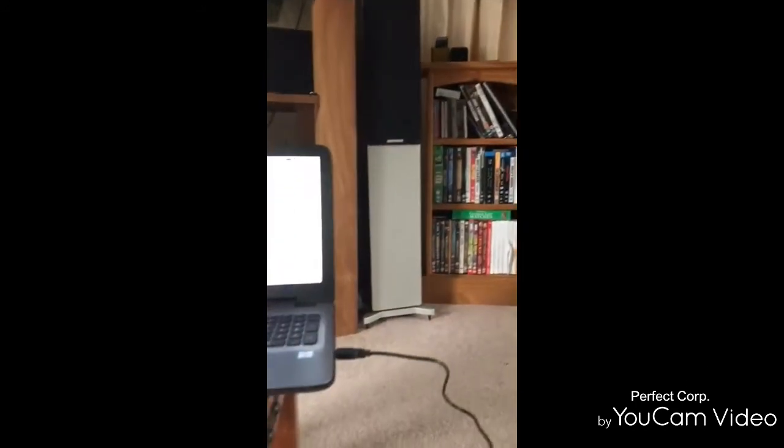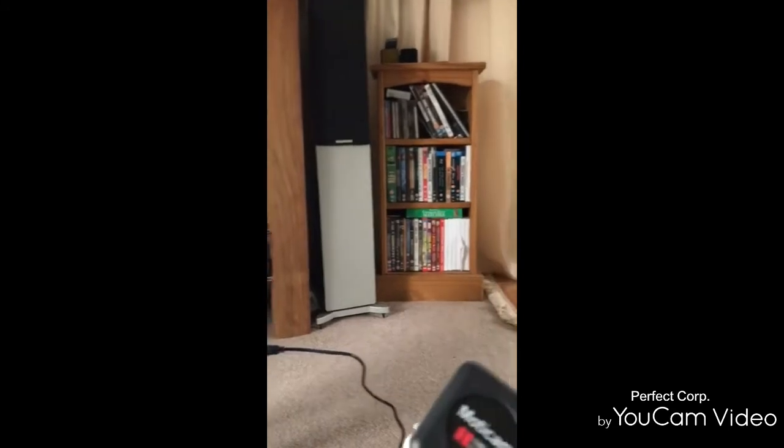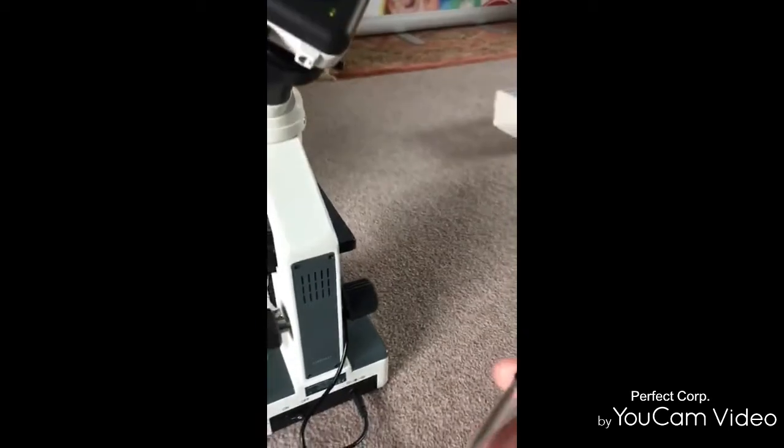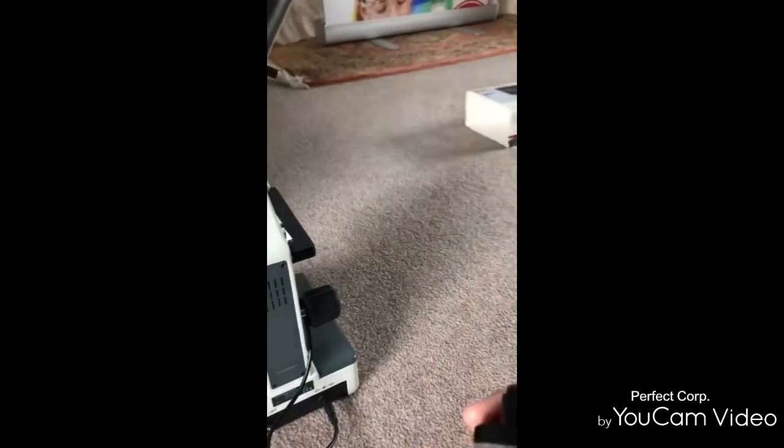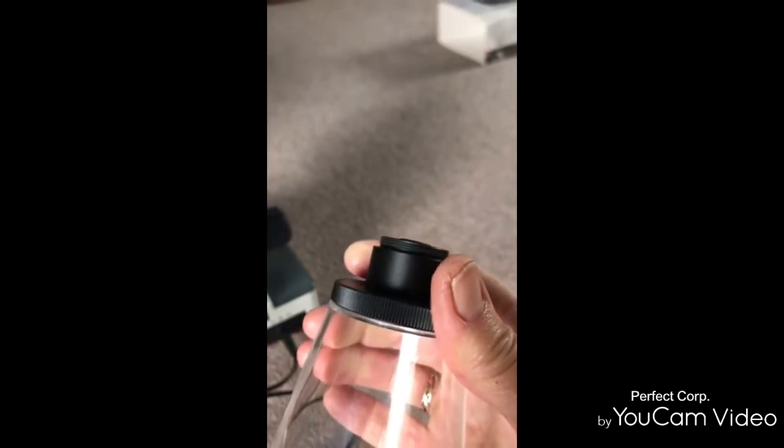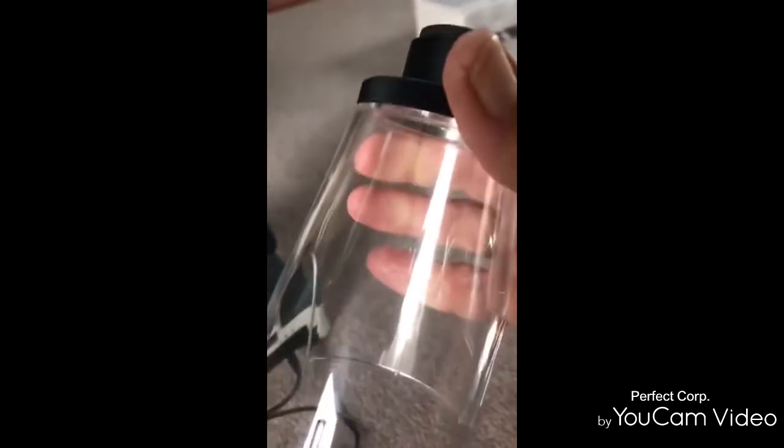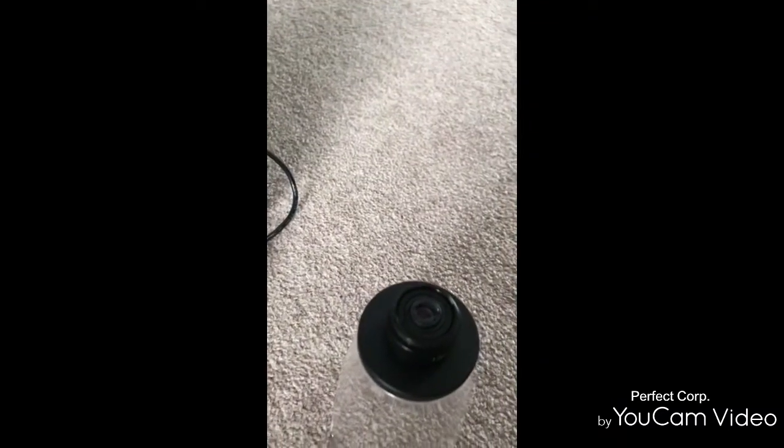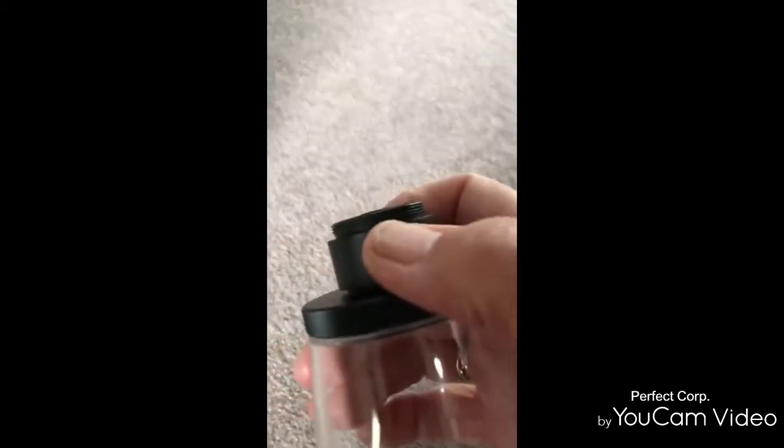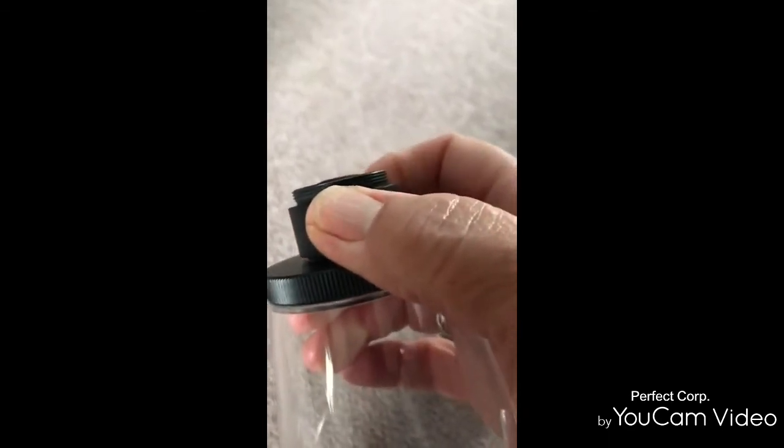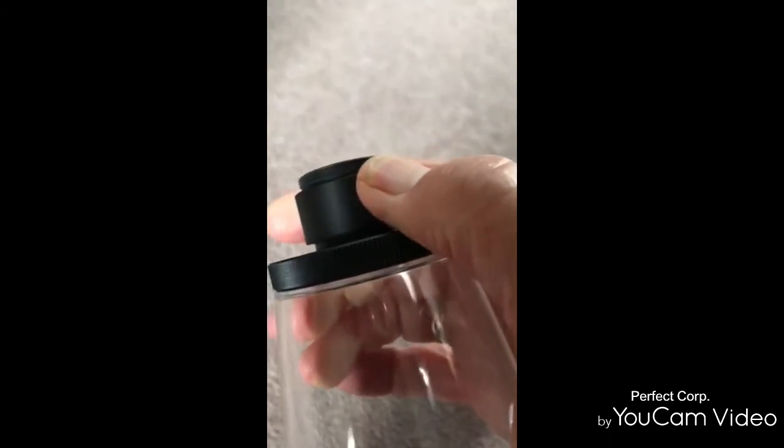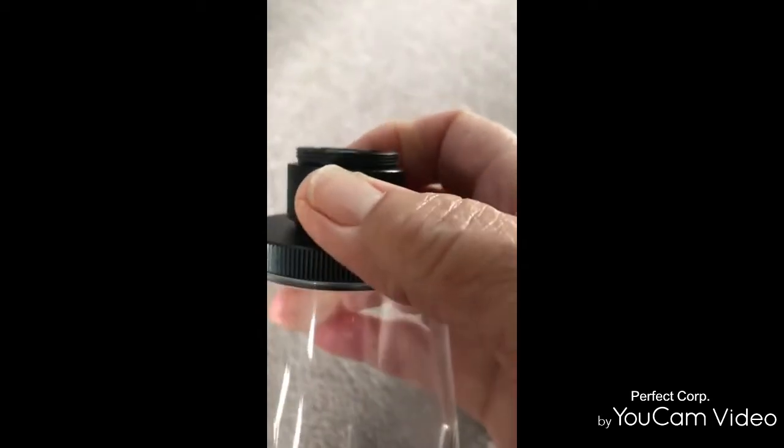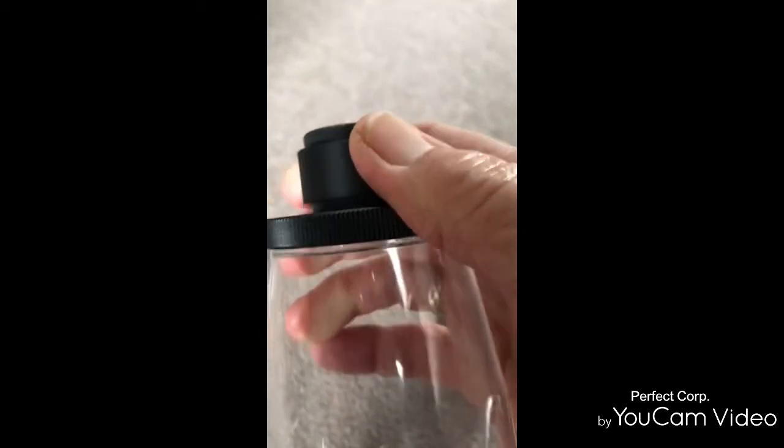You can also use it as a macro lens by connecting the focusable lens to the macro viewer. I am just going to show you that the focusing part is here, because once you have it connected to the camera it's difficult to see what you're moving.